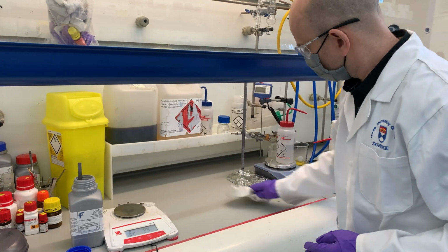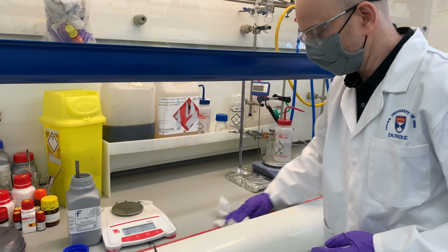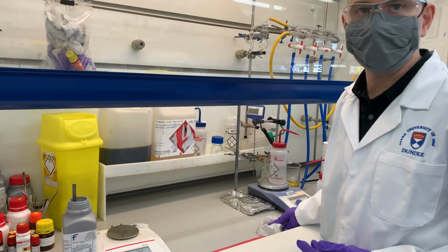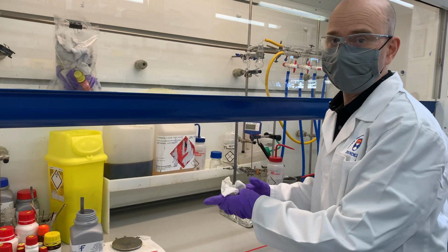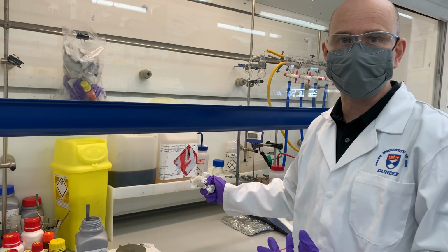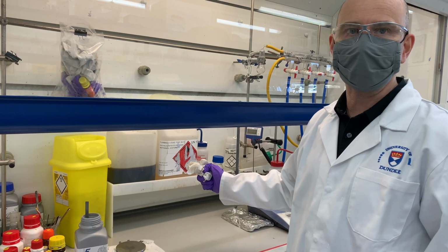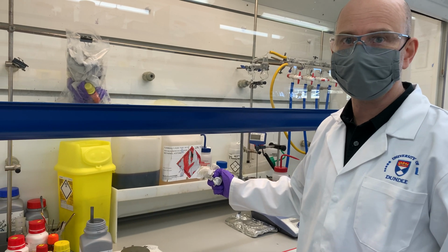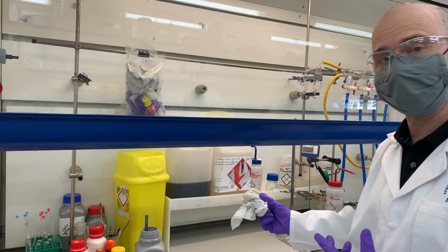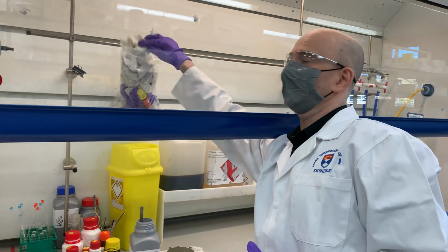That's what I would use for water-soluble spillages, like carbonates or anything like that. If it was something organic soluble, I would use acetone, ethanol, or another kind of innocuous standard solvent. And then again, all cleaning material or anything that I've used must go into the contaminated bins inside of the fume hood.